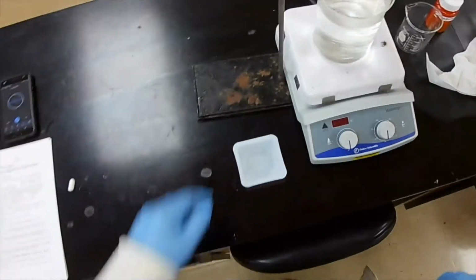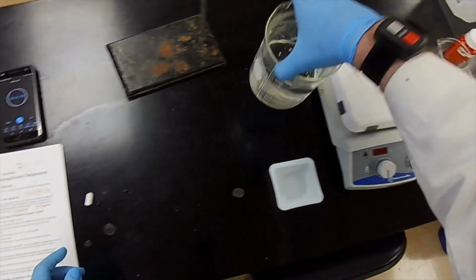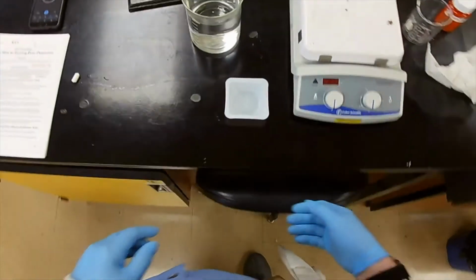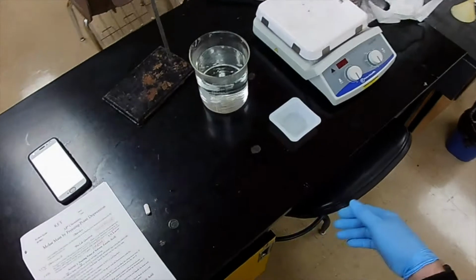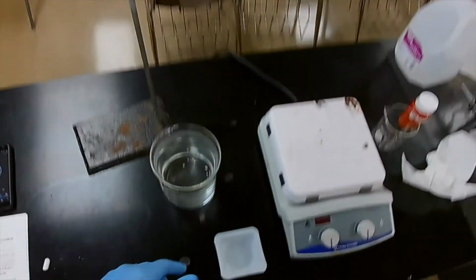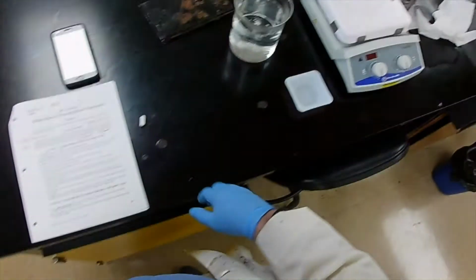And let's remove the hot water so that it'll cool down faster. Now, what can we do with this distilled water? That is distilled water. Well, can't use it anymore. Why? Because we've contaminated it. We put boiling chips in it. So, once it's cool enough, we pour it down the drain, clean the beaker out, put it back on a shelf.